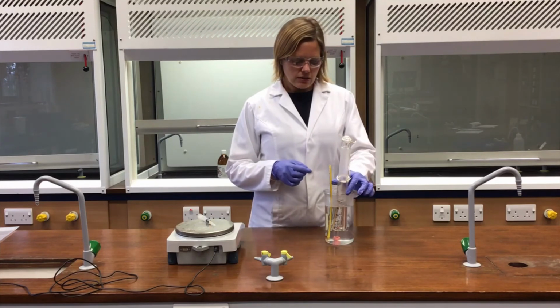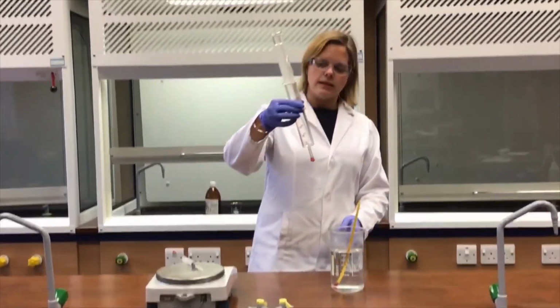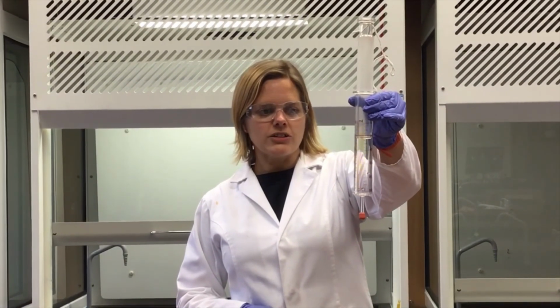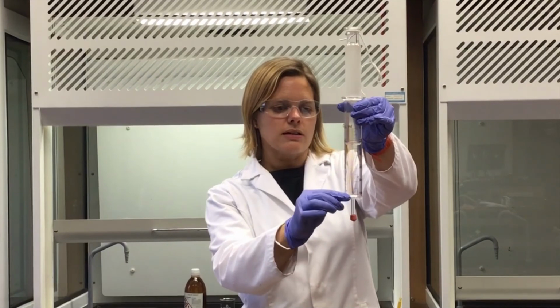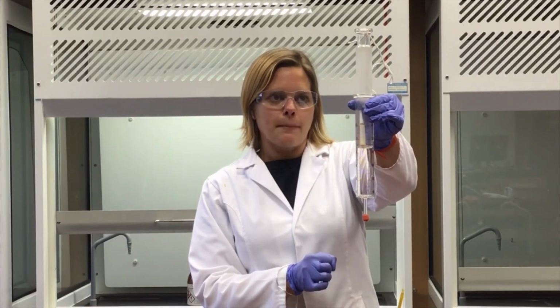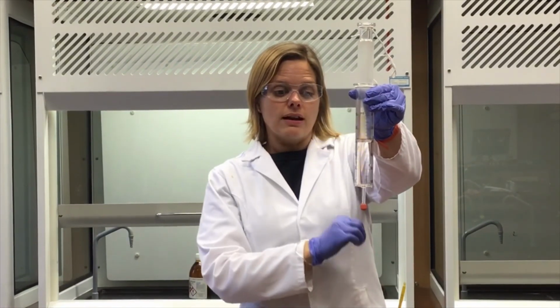Before we finish, I might show you what happens though if I take this out of this beaker of hot water, because this is quite interesting. So take it out of the beaker of hot water and just let it cool down a little bit, and the hexane starts to condense, and eventually we get below the boiling point of hexane. I can see some condensing hexane just on the sides of this gas syringe inside there just now, and watch what happens to the barrel of the syringe all of a sudden as the boiling point of hexane is not met. As the temperature reduces down, the volume contracts, absolutely loads, which gives a little bit of evidence that gases have a much greater volume than the associated liquid.